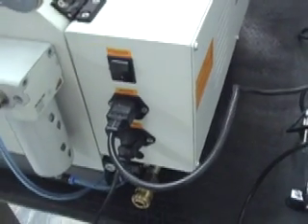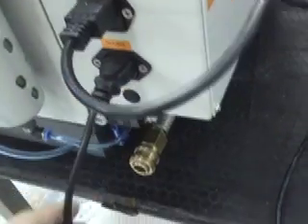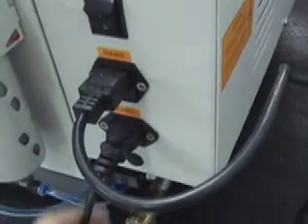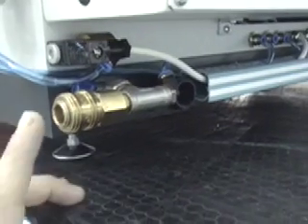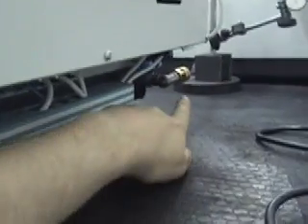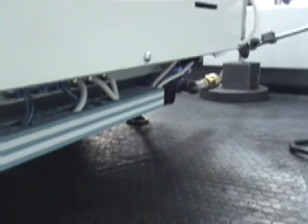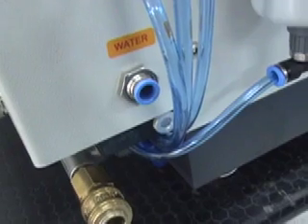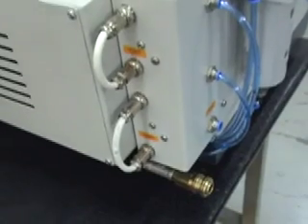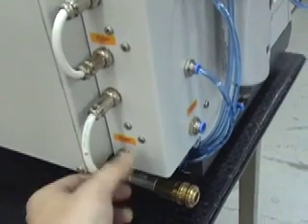The GeoForm is easy to install. It has two power sockets for mains and for the vacuum pump. It also has two quick-release water feeds for the optional recirculation tank, and can also be used with mains water. If using the recirculation tank, it is connected here — first remove the link cable.